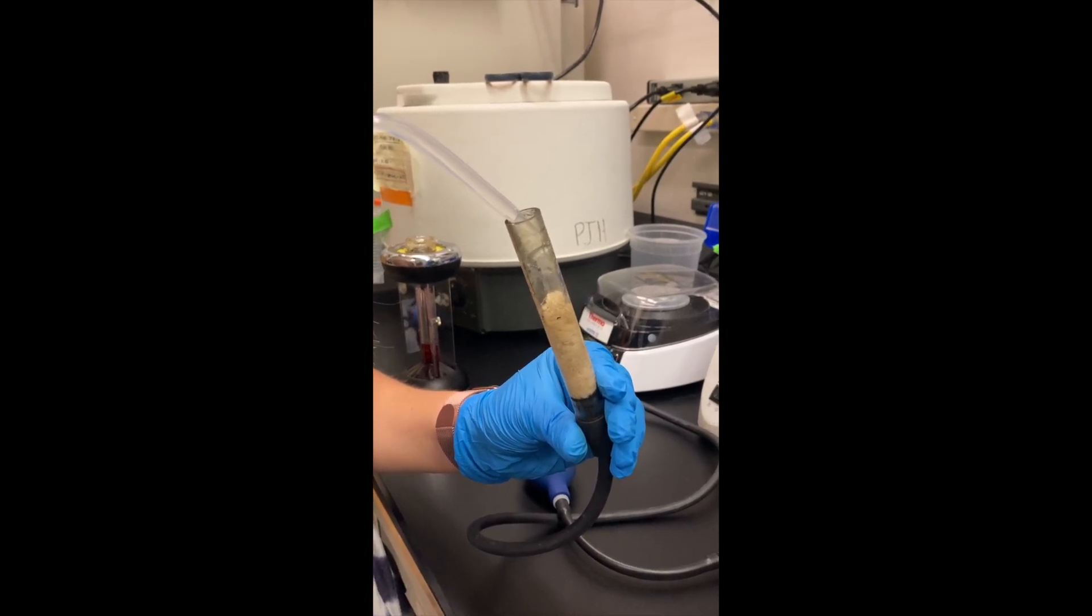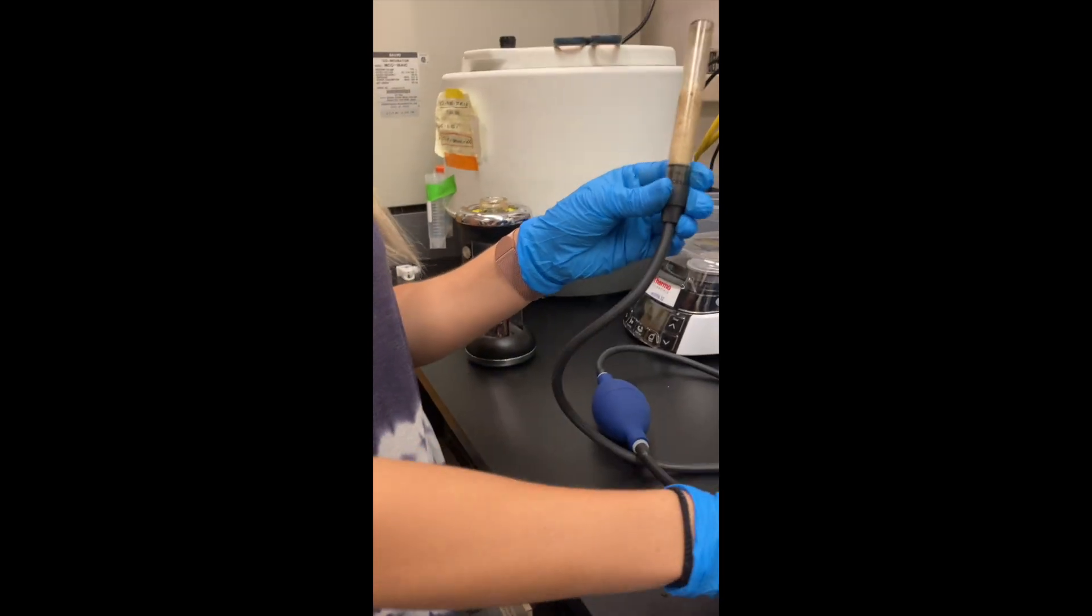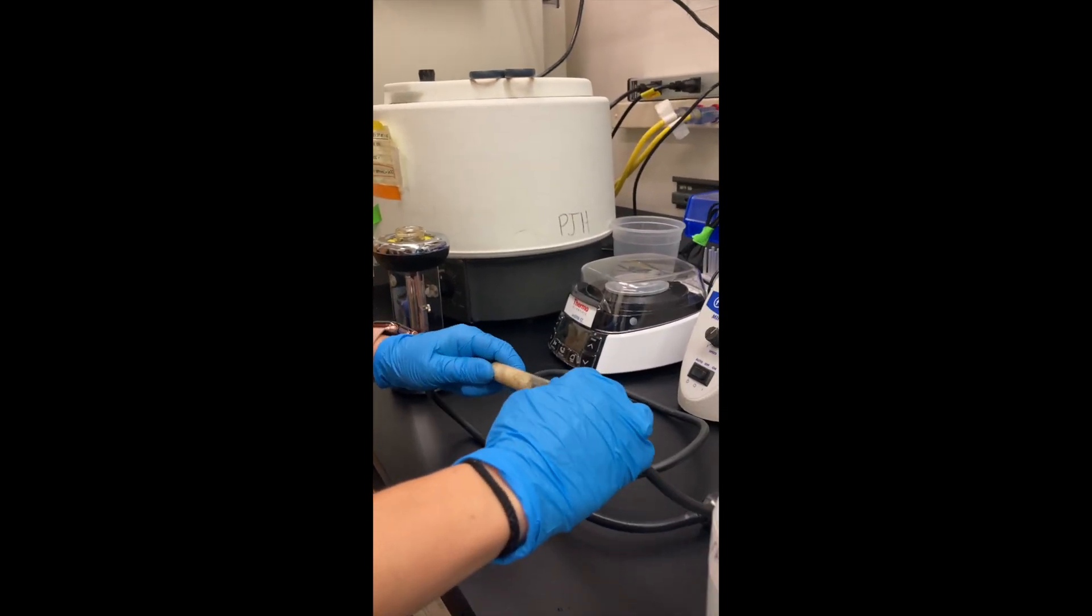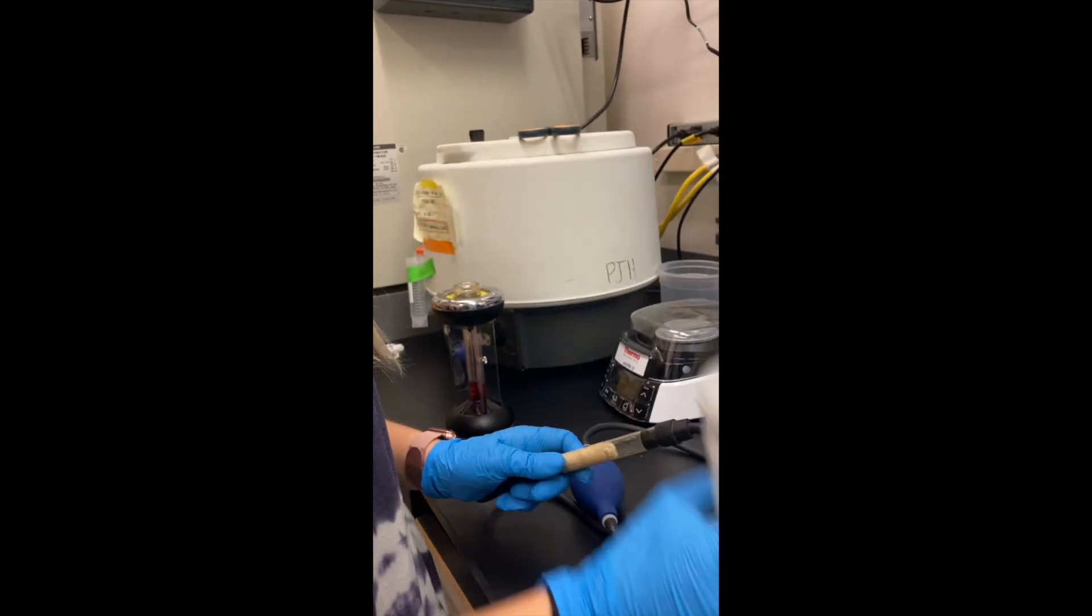In that case, this one is already wet because we just used it. But that's how you would do it. So you close this, and this is just double distilled water. So come here.